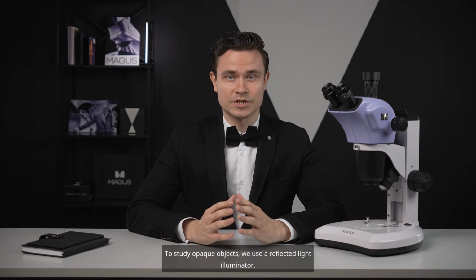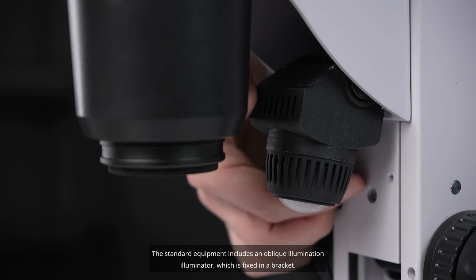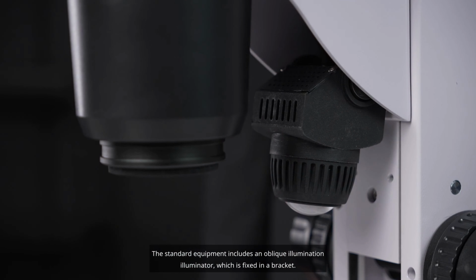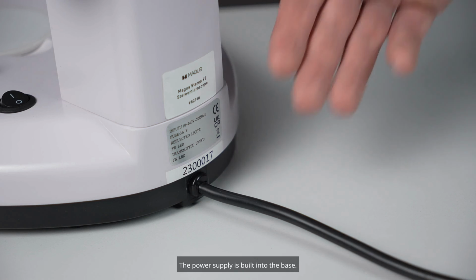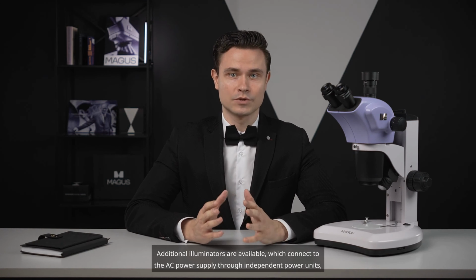To study opaque objects, we use a reflected light illuminator. The standard equipment includes an oblique illumination illuminator, which is fixed in a bracket. The illuminator's plug is installed in the tripod socket. The power supply is built into the base. Additional illuminators are available, which connect to the AC power supply through independent power units, regardless of the microscope.